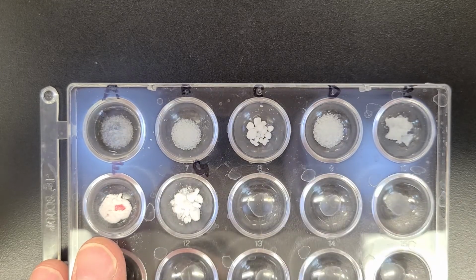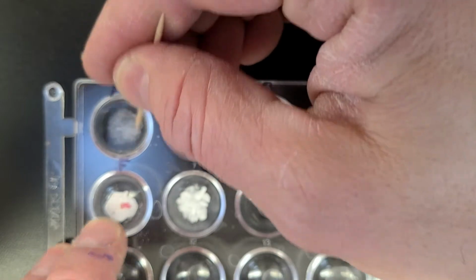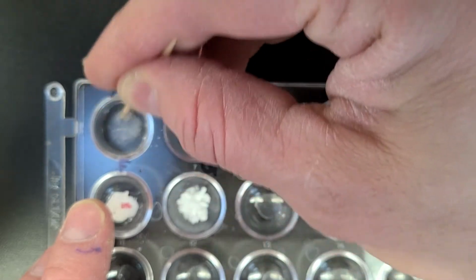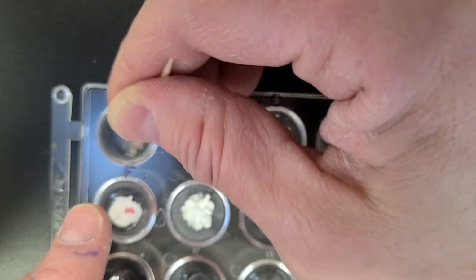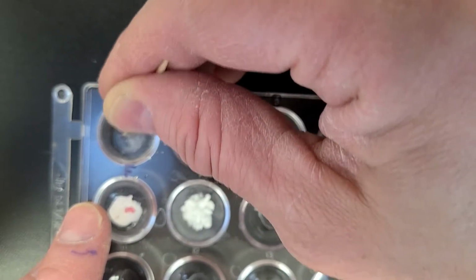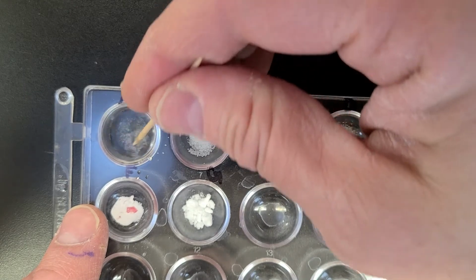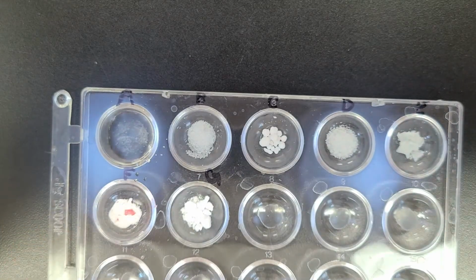Okay, so I'll fill that up. Take note of what happens here. So we have what we had originally there. Now, does it appear to be disappearing? I'm not going to say either way. I'll leave it up to you to decide whether you think it's disappearing a bit. So remember how much we had originally, about that much. Take a look at what's going on now. Here's the first one.